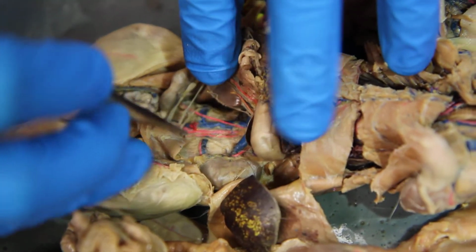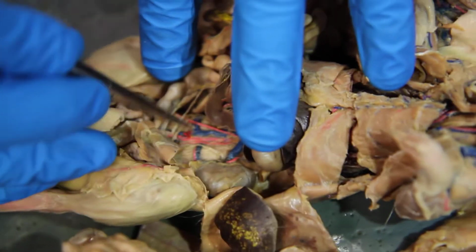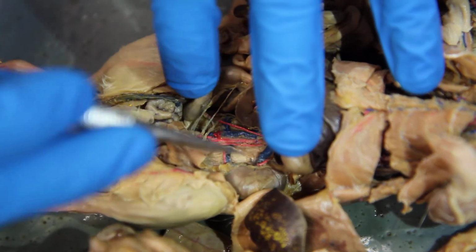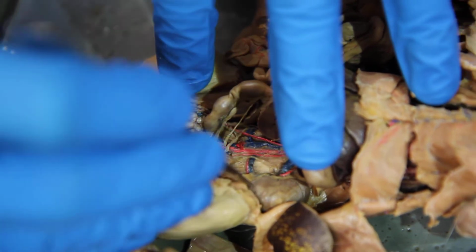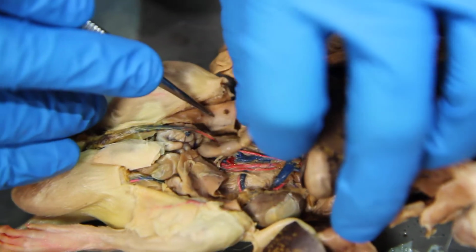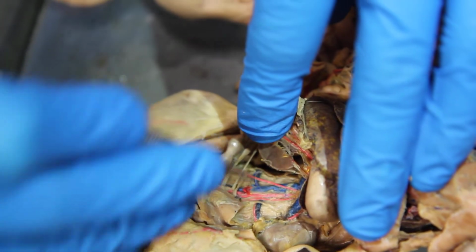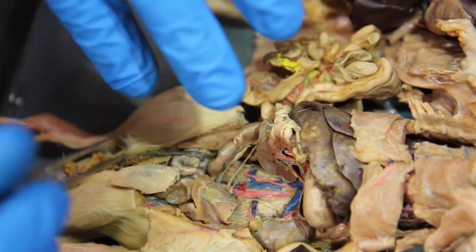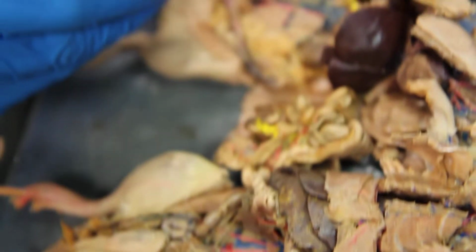Now we're going to go down a little more, and there's basically these two arteries that go to the sides like this. These are called circumflex iliac arteries, and they're going to beds of fat. Beds of fat that are back here on each side. So circumflex iliac, this one and this one. And then we go to the last one.